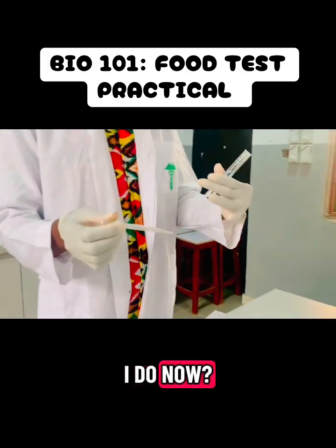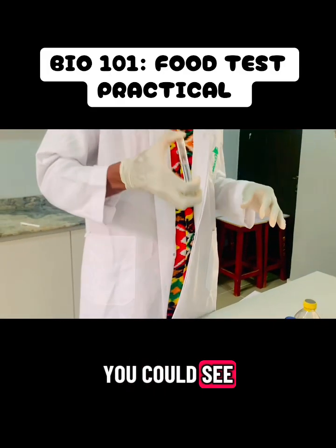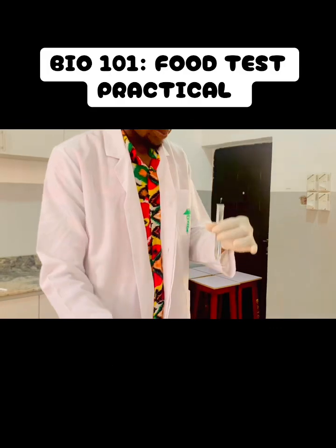Now what do I do? I added my Benedict's solution to it, and as soon as I did that, you could see a color change, and then my sodium hydroxide.